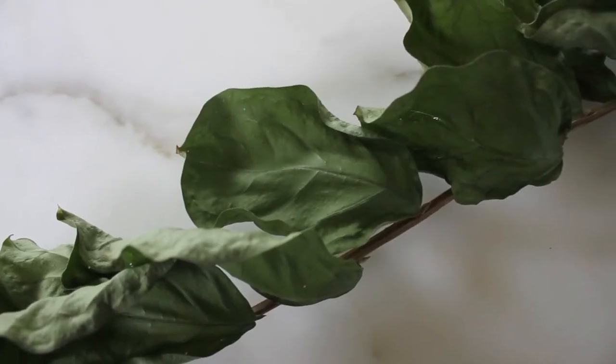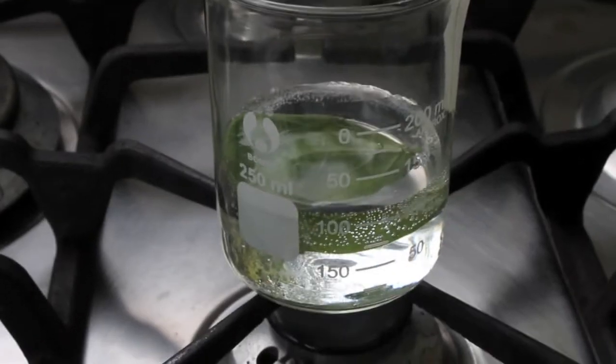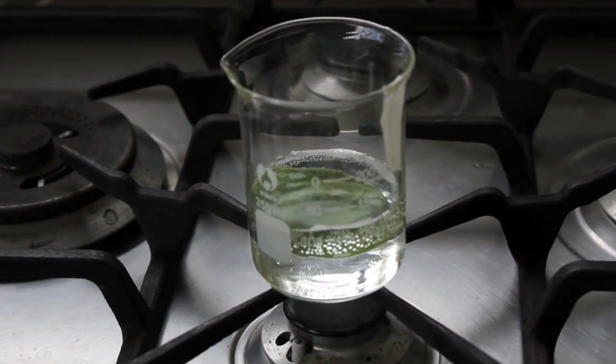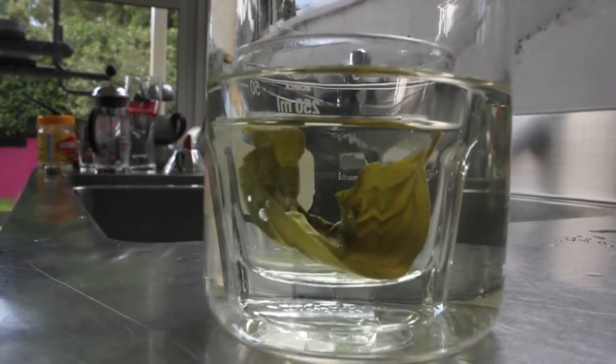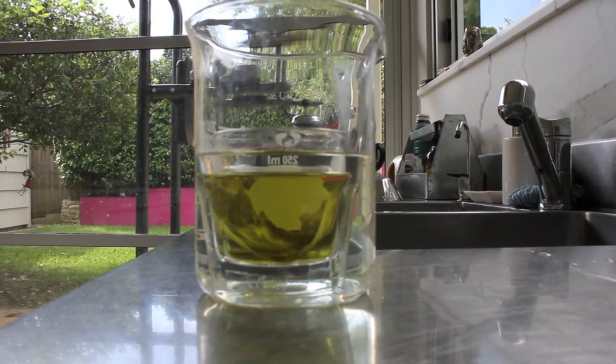The plants were then tested for starch. Its presence in the leaf would highlight that photosynthesis had occurred under its condition. To test for starch, the leaf was firstly placed in boiling water to soften the leaf and break down the cell wall. This boiled water then acted as a water bath for methylated spirits. The soft leaf was then placed in methylated spirits so as to remove the chlorophyll from the leaf.